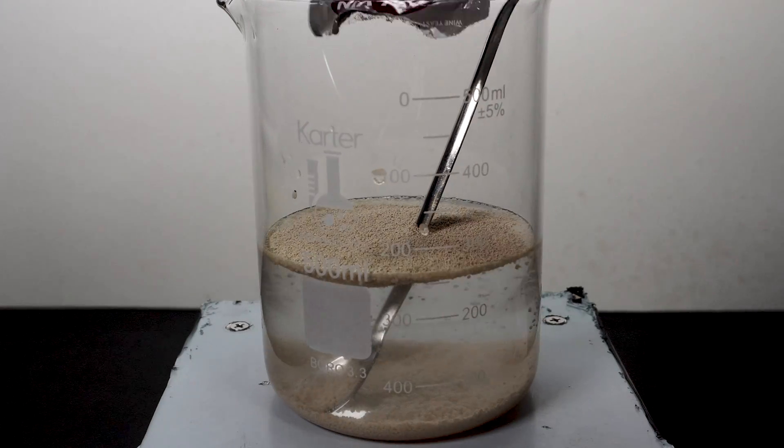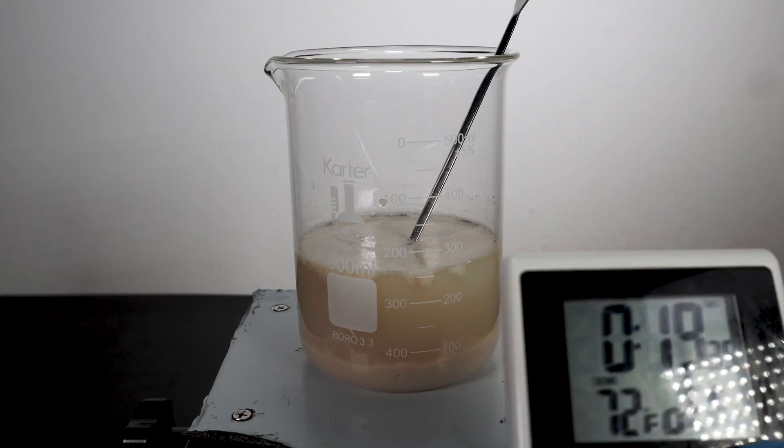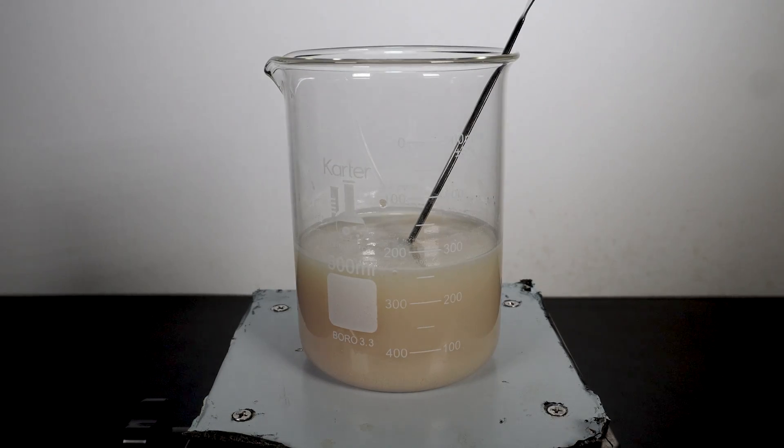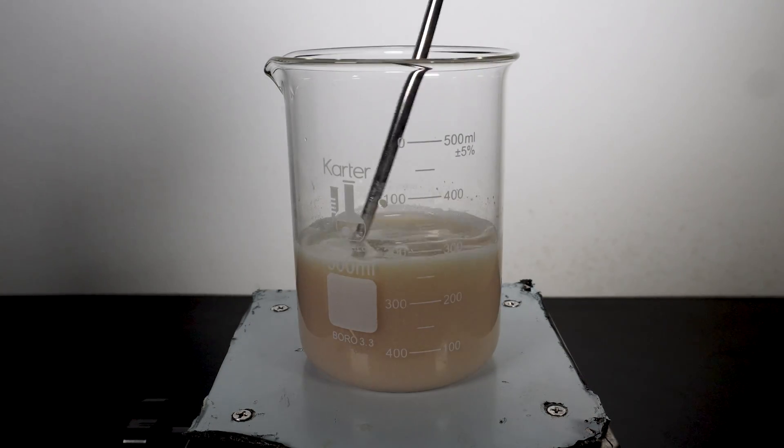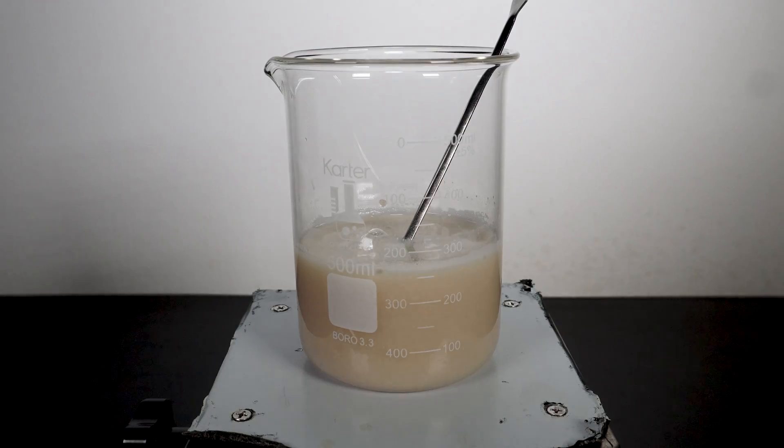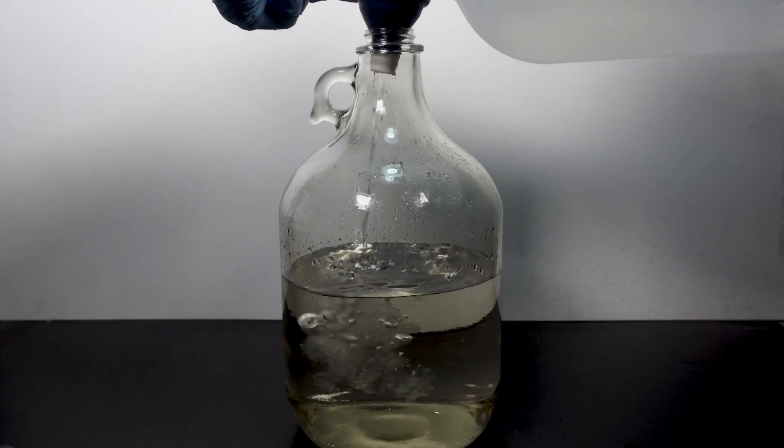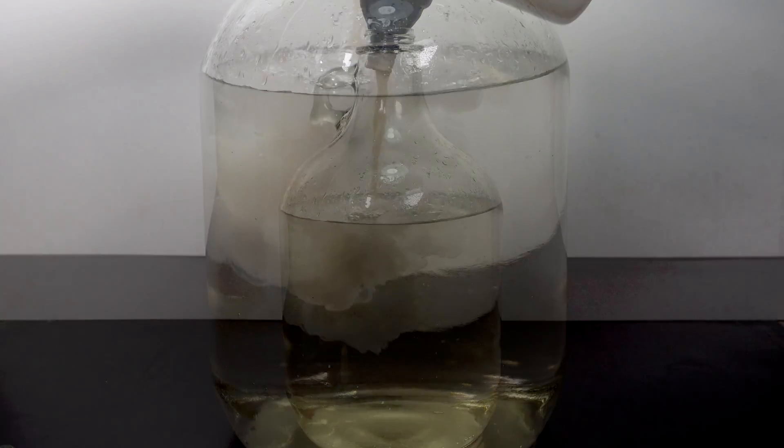The way we do this is just adding a small amount of sugar and look for bubbling in the yeast. This will confirm fermentation is happening. When I did this though, I didn't see much bubbling and I was worried that I might have gotten some dead yeast, but I continued anyway with pretty high hopes. To start off, I top off the sugar wash with about 1000 ml of distilled water before adding in my now hopefully active yeast.